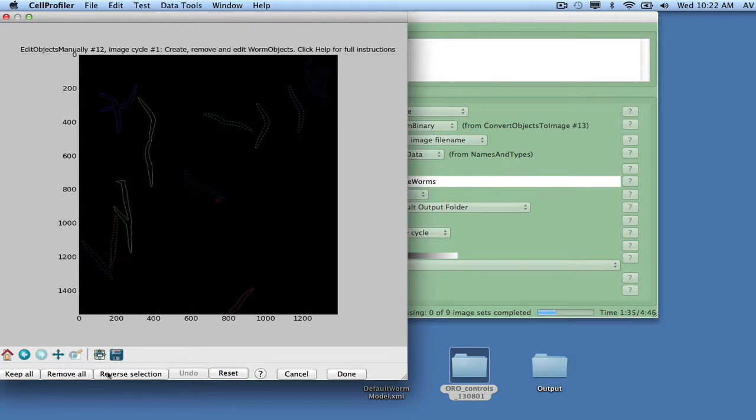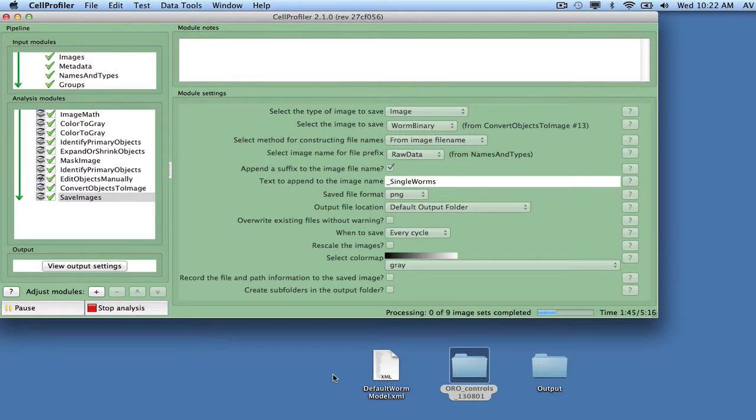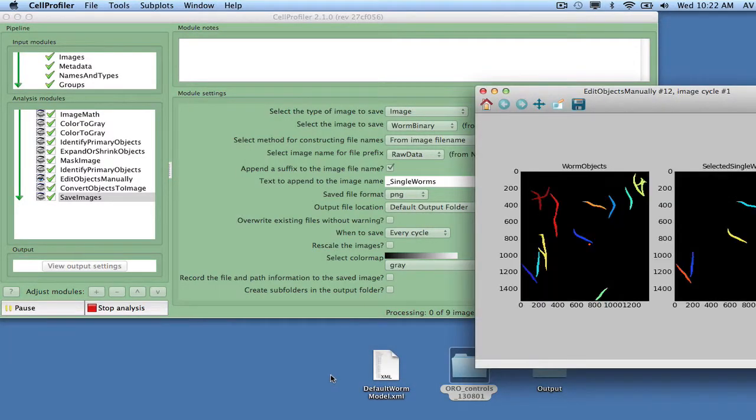When all single worms have been selected in the image, click on the Reverse Selection button. At this point, only the single worms will show up with solid outlines. Click the Done button to finalize selection. The selected worm objects will now be retained for saving by Save Images, and the next image in the list of input files will be processed.